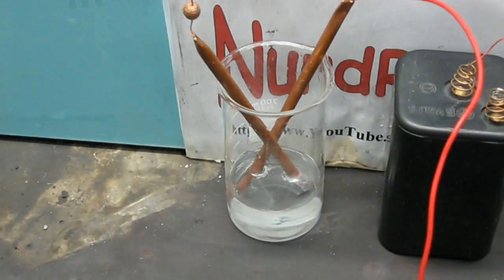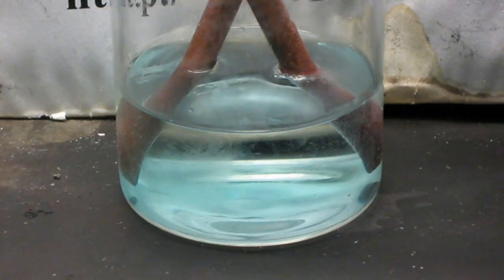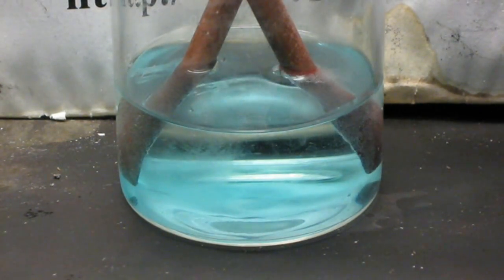I'm using a battery for demonstration but it's cheaper in the long run to use a power supply. Alright, let me adjust the camera. The negative electrode is generating hydrogen gas, which you can see bubbling out on the right electrode. The positive electrode is dissolving into the sulfuric acid as it's being oxidized by the electric current. The copper sulfate being generated turns the solution a blue color.